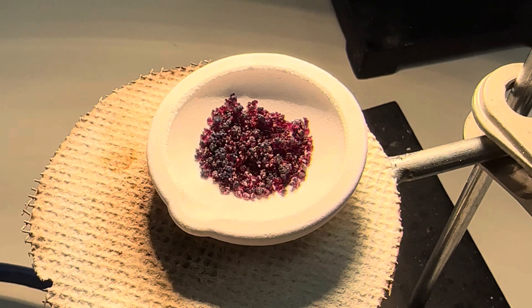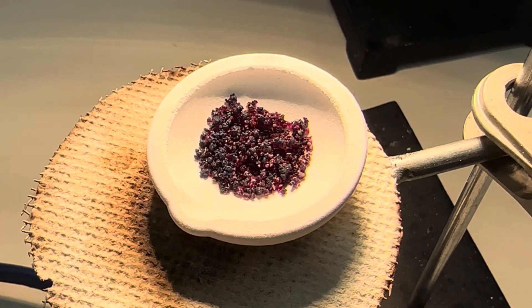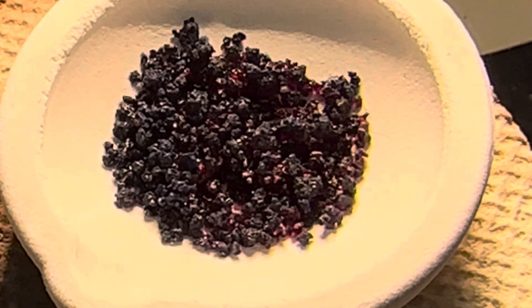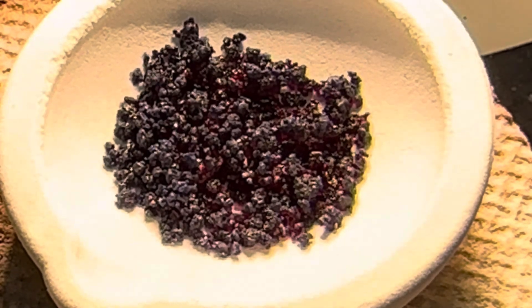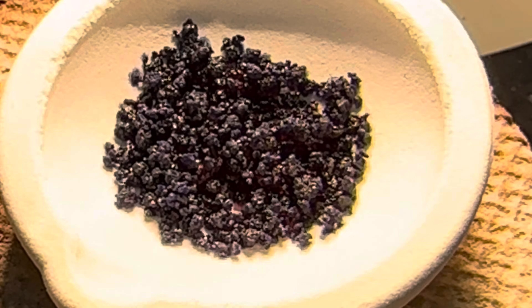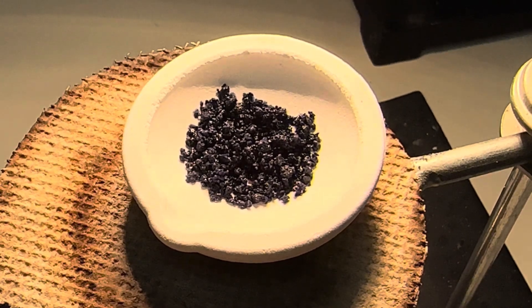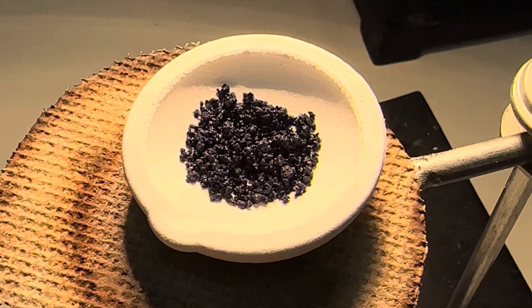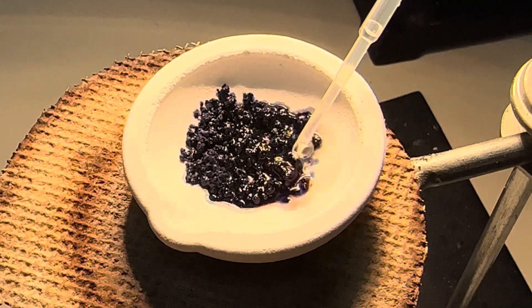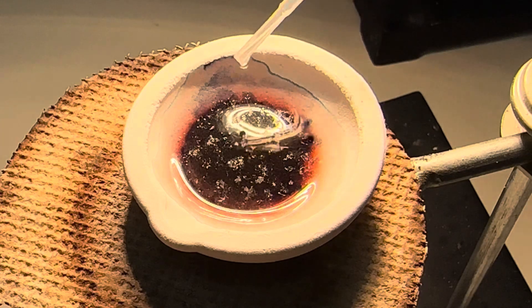Let's see if the whole thing will turn blue. I can start to see a change. Definitely more blue. Now we're going to start adding water and see what happens — we're going to move our heat. Here's a little bit of water. You can start seeing that red around the edges, kind of a pink color. We start to reverse the reaction.